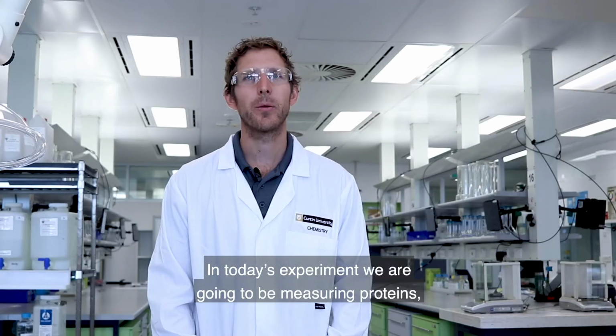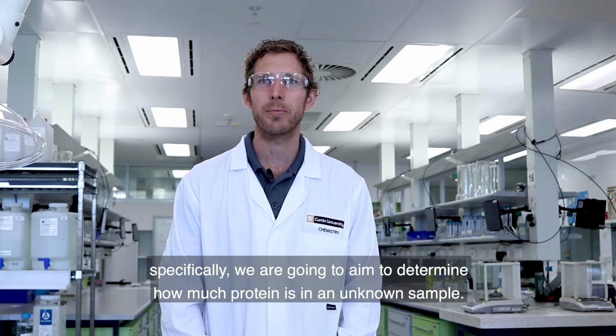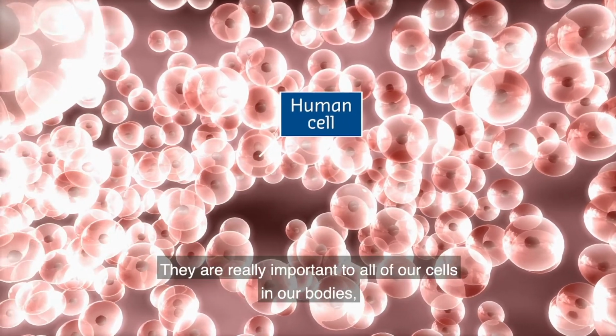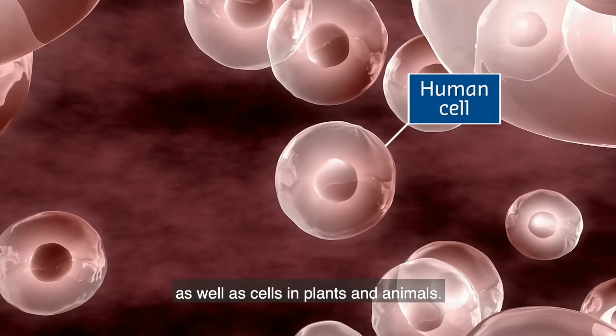In today's experiment, we are going to be measuring proteins, and specifically we're going to aim to determine how much protein is in an unknown sample. Proteins are essential for biology. They're really important to all of our cells in our bodies, as well as cells in plants and animals.